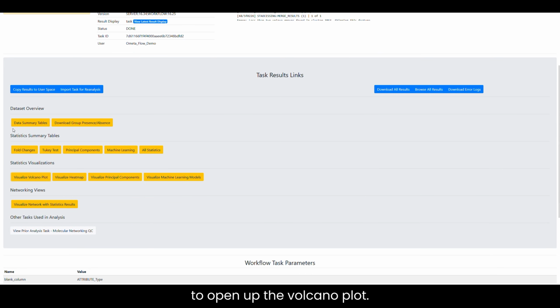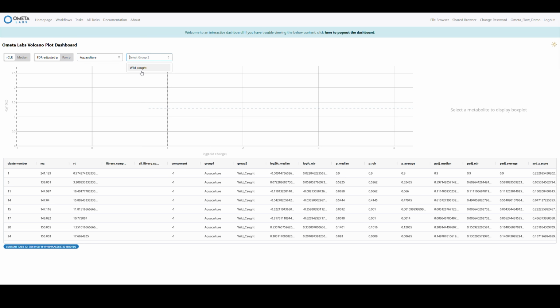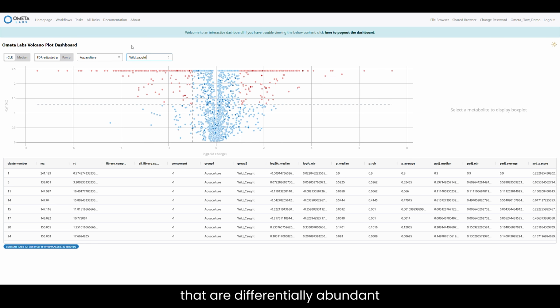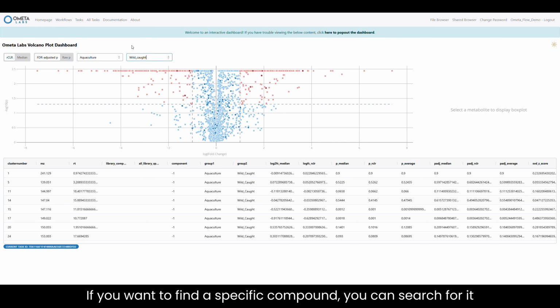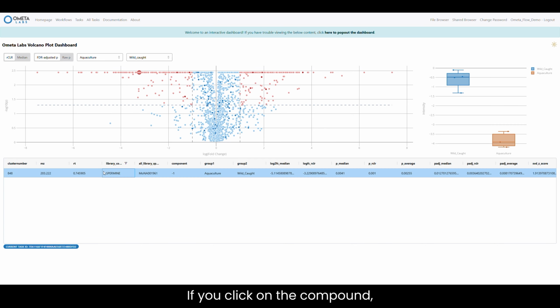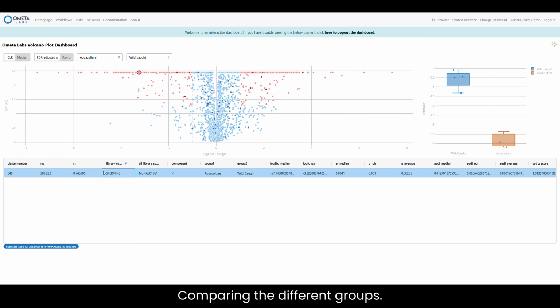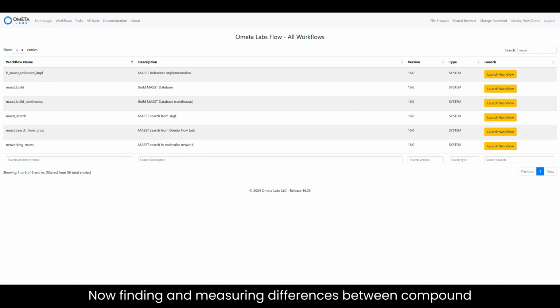To open up the volcano plot, click the button here, and then select which groups you want to compare. This shows us all the metabolites that are differentially abundant in wild-caught and aquacultured salmon. If you want to find a specific compound, you can search for it here. If you click on the compound, you can highlight that compound in the plot and draw a box plot comparing the different groups. Now, finding and measuring differences between compound abundances is great, but how do you figure out where these compounds came from? This is especially important if you've identified a contaminant and want to know what batch or source material it originates from.